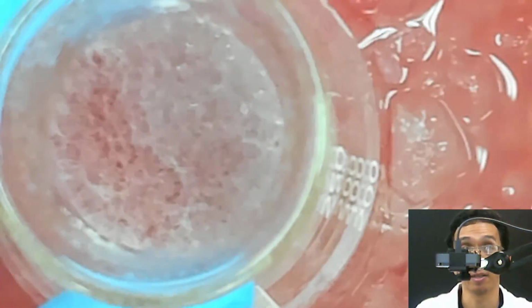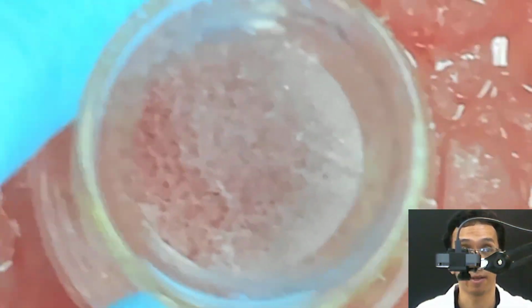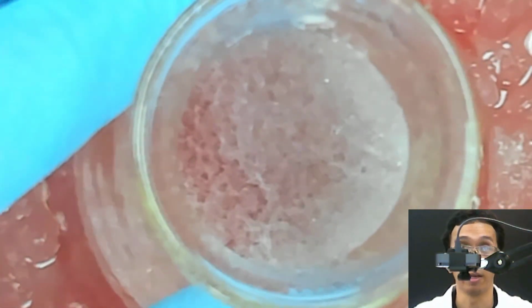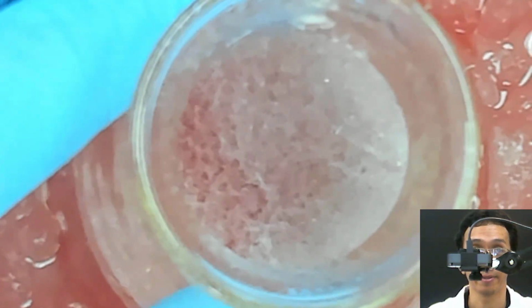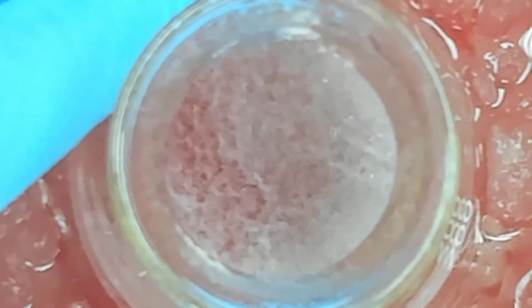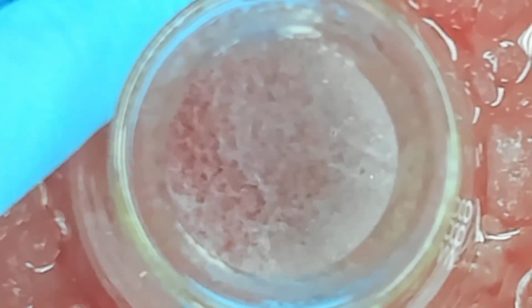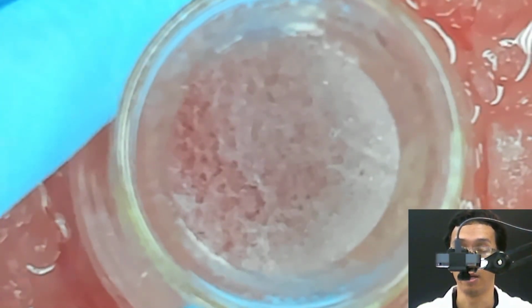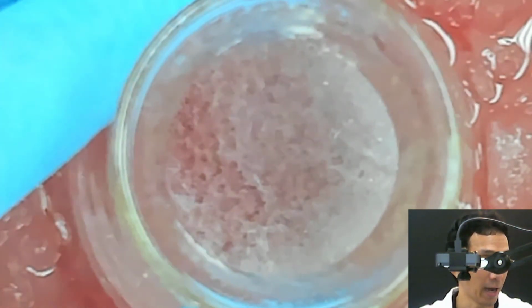Okay, this is fast, what we call fast, when you do a fast cooling. So I will remove this myself, and for your lab report, take this picture in the video recording, take this clip picture and then discuss. Okay, so that I bring myself again. Okay, so basically we are done with that.